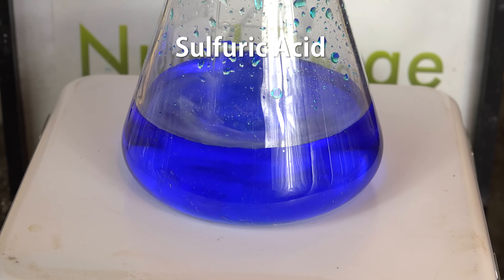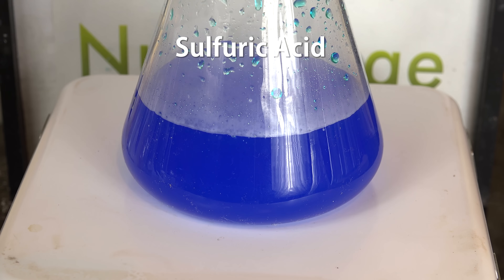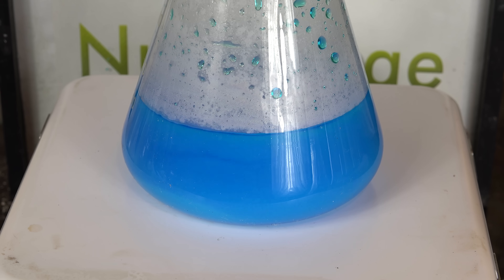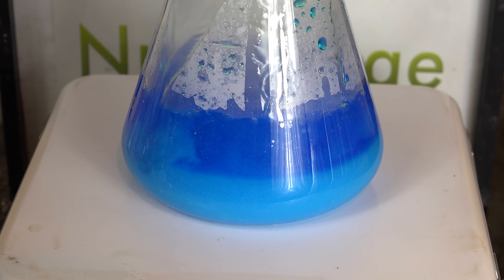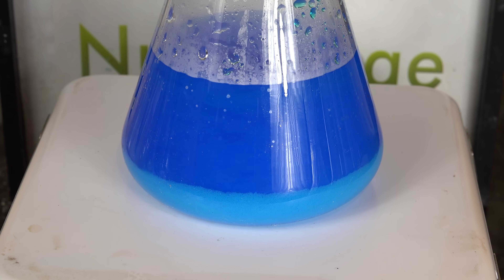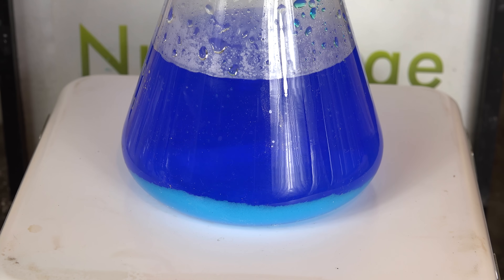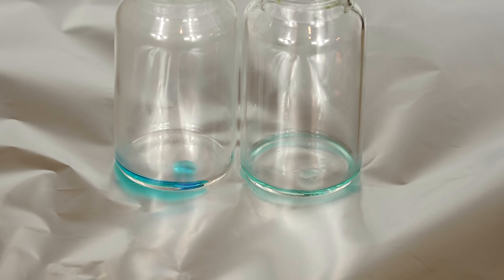First just make a guess and add in some sulfuric acid that you think will be enough to react with all the copper and stir. If you precipitate a large amount of copper sulfate, as I have here, then add in some water and stir to dissolve it. Some precipitate is fine, about 10% by volume, but more than that and you should add in water to prevent trapping of the copper nitrate. After stirring, take out a small sample of a few drops in a vial and heat it on the hot plate to about 300 celsius.